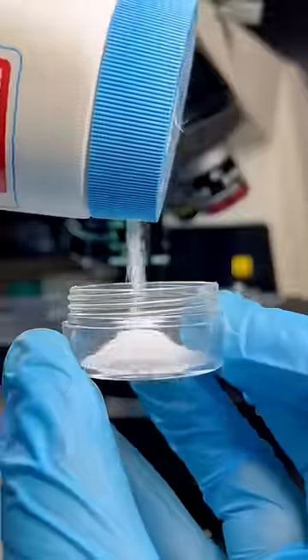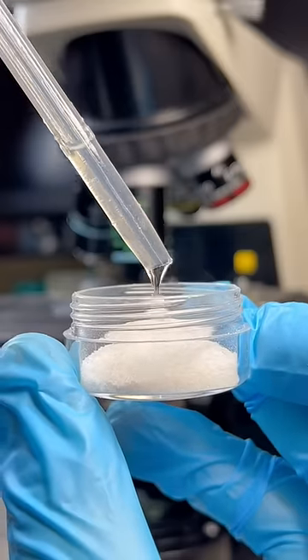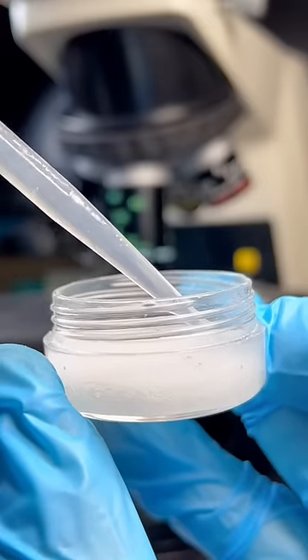I added some salt to a container and then I made a saturated solution of salt water. This is what happened after adding one or two drops.